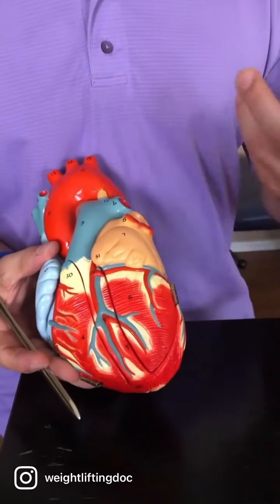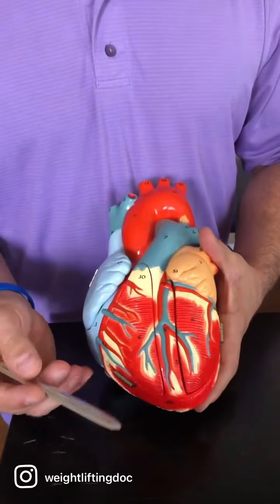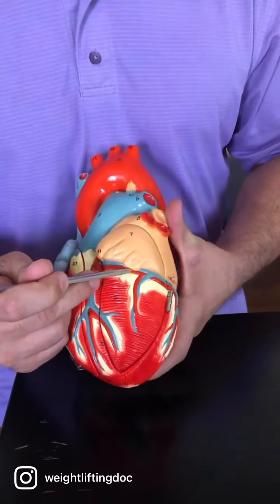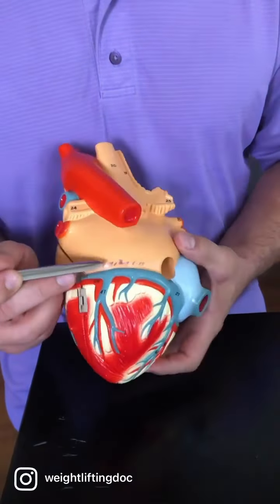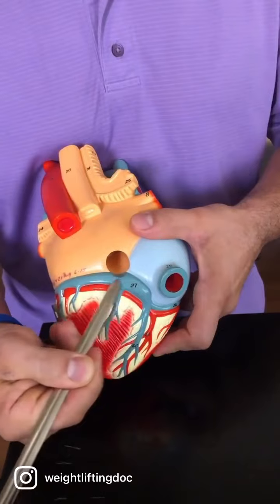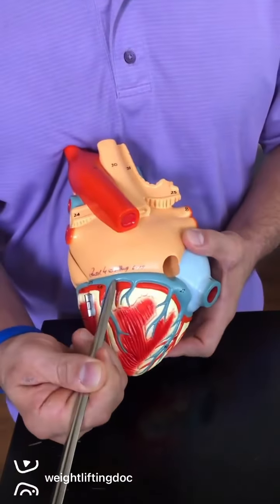Now we have to drain the blood from the heart, so we have some veins that we'll talk about here. This one coming up, this one going around. This is all the same one, coming all the way around, and it stops right there. It's dumping into this bag again. That's the coronary sinus, number 27 there. That's the coronary sinus that goes from here, let's say from here, all the way to there.